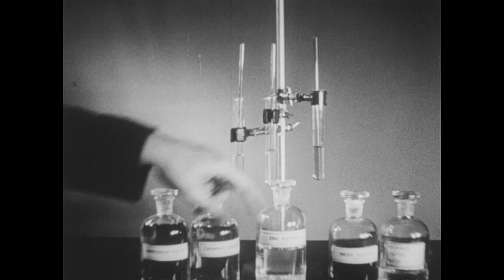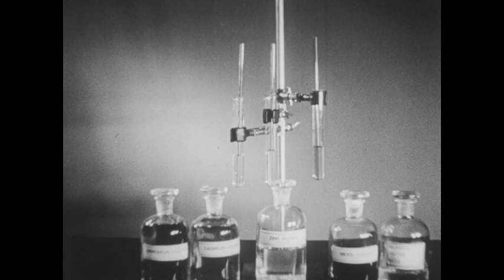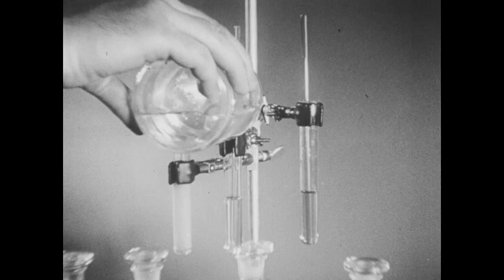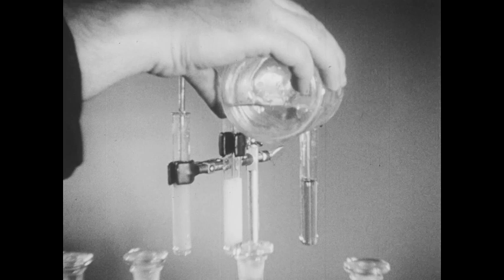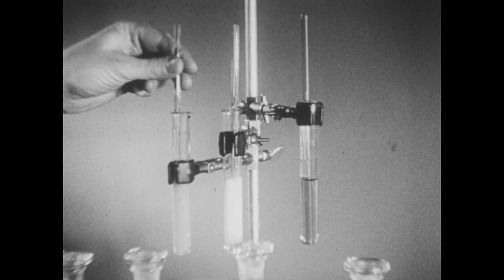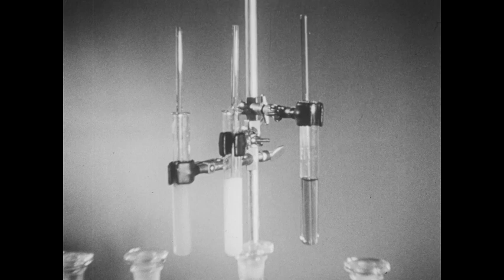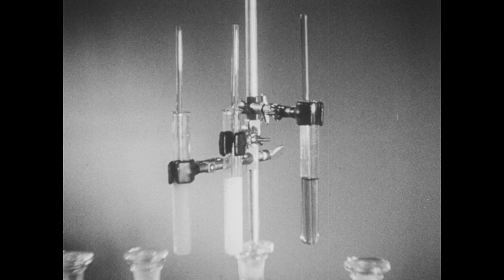In this test tube we place some cadmium sulfate solution, in this tube some zinc sulfate, and in this tube some nickel sulfate. To each of these tubes I'm going to add a few milliliters of hydrogen sulfide water. In the tube on the left, you can see the brilliant yellow precipitate of cadmium sulfide. In the tube in the middle, the white precipitate of zinc sulfide. In the tube containing the nickel ion, however, no precipitate occurs with hydrogen sulfide water.